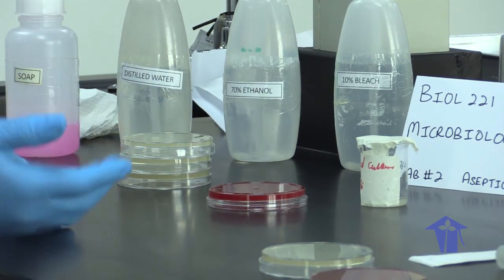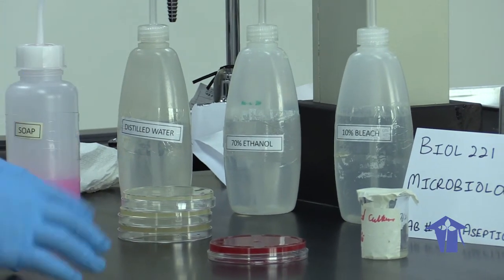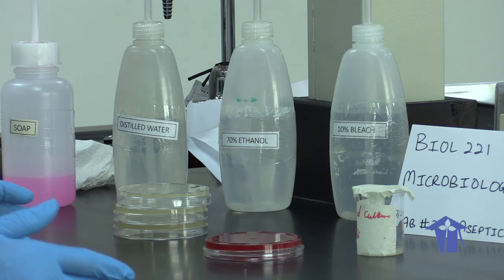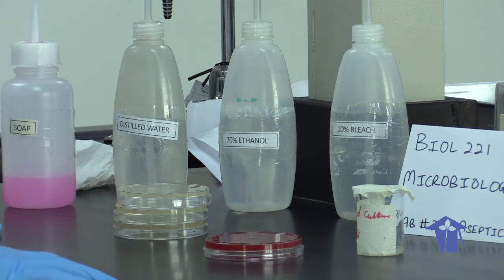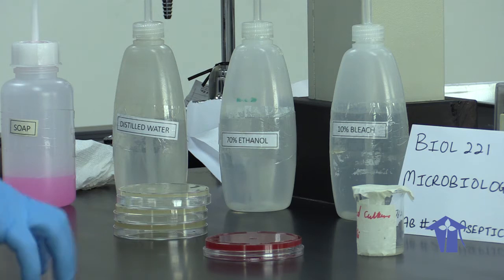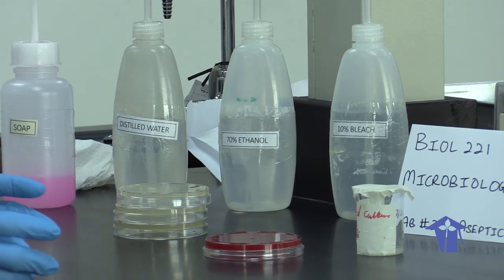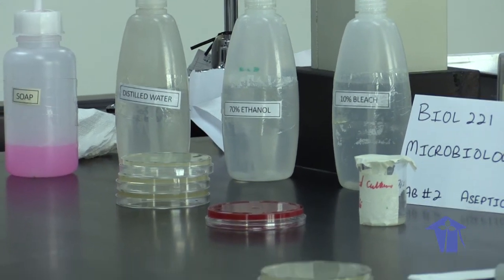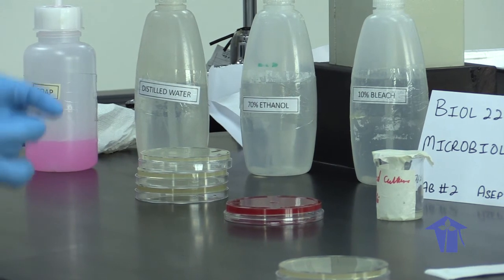When we look under the microscope, there are different things we look for to differentiate between species — whether they're gram-positive, gram-negative, the shape of the cells. When we look at the entire colony, we can also identify certain species based on their pattern of growth. Each colony is millions of cells, but the overall pattern of growth is distinctive depending on which type of organism you have. You need to get a pure colony — when a pure culture has sufficient medium around it, it can absorb enough nutrients that the colony grows larger and shows more of its morphological characteristics. When colonies are too condensed and you have too many cells per unit area, the colonies grow smaller in a reduced way.